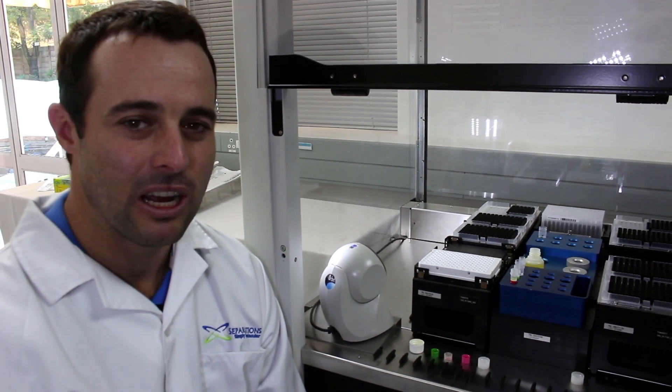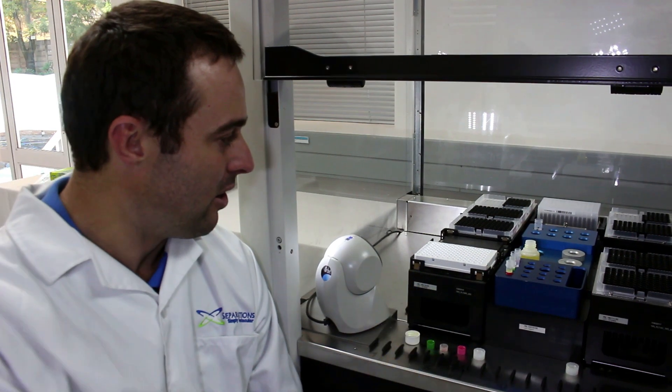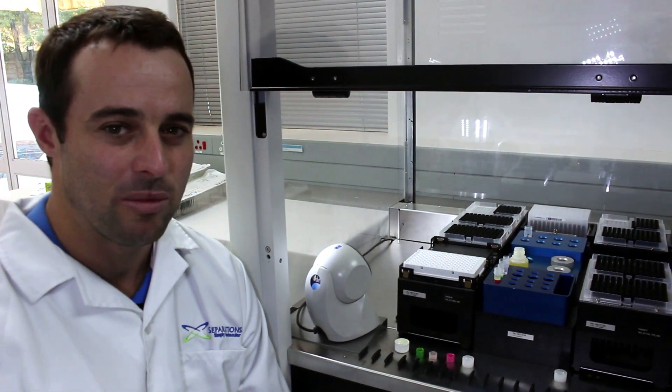While shaking, a PCR master mix is prepared, after which an aliquot of the master mix is aliquoted into the PCR plate. After shaking, an aliquot of the DNA sample is placed into the PCR plate as well.